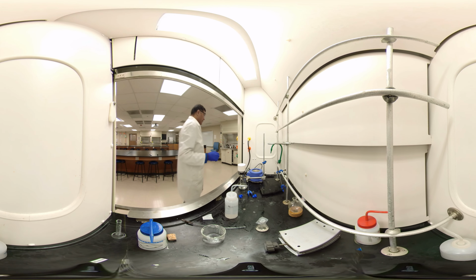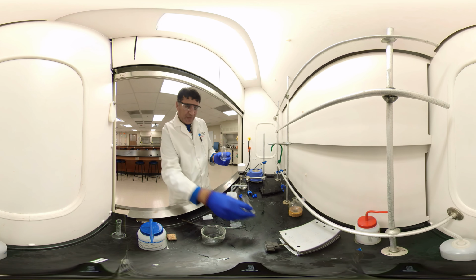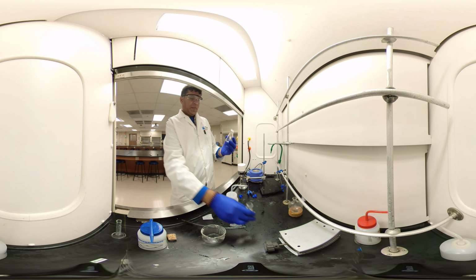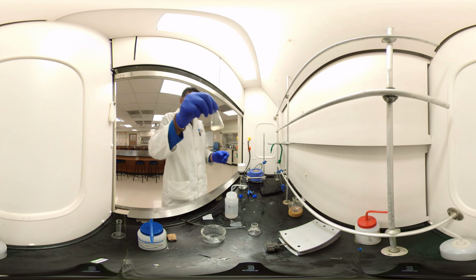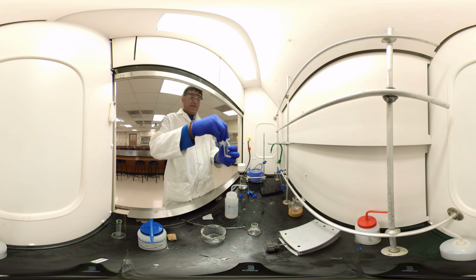And this one, the liquid, it's about 5 minutes already. So I'll decant the liquid. Collect the weight of this one first. I tared this one, so I know how much I have. So I'll transfer the liquid only. That's the benzyl alcohol that I have. It says 4 to 5 grams. So I have the liquid. This one I have 5 grams. Yeah, I'll collect the IR later.